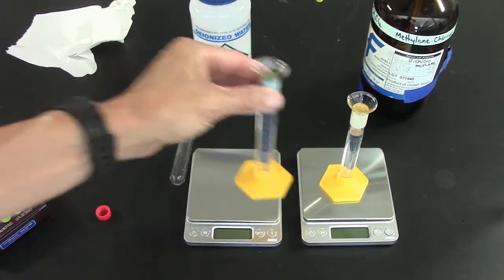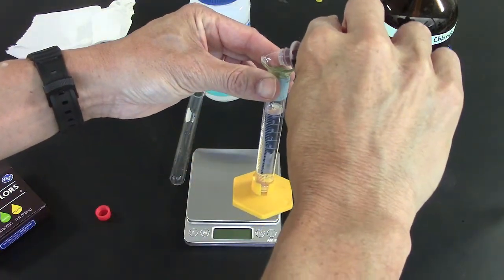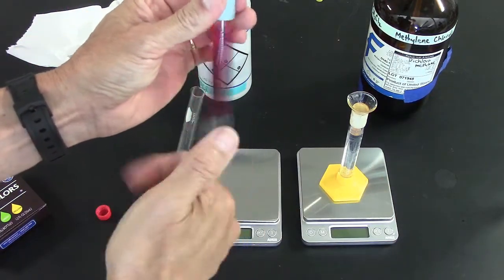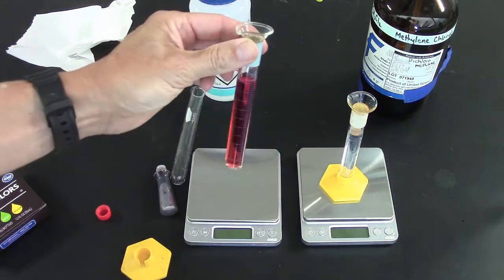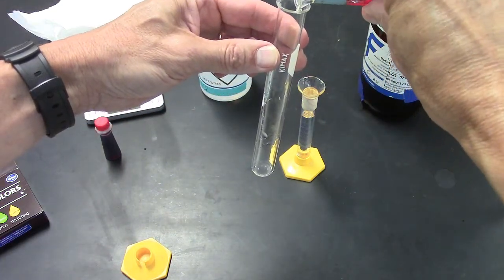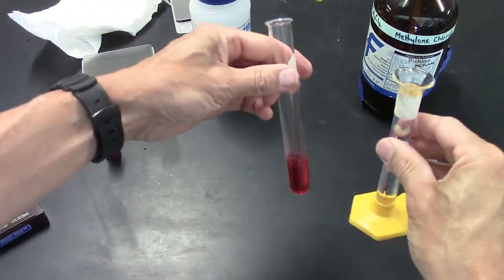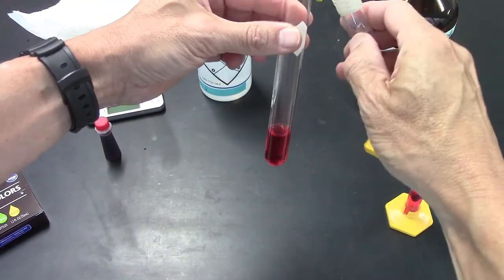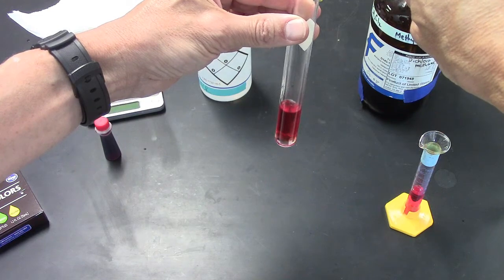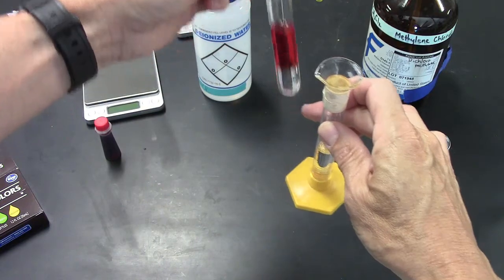So I'm now going to mix the two, but I'll add a little color first to the water. And I'll mix it up. All right, great. So I'll put some of the red water in this test tube. There we go. And now I'll add some of the denser dichloromethane. And I think you can see that the denser dichloromethane is going to the bottom.